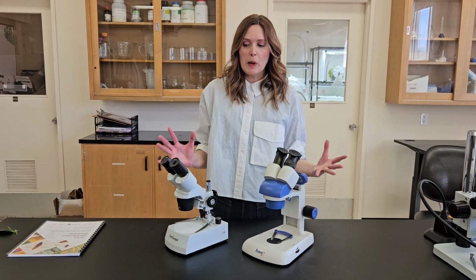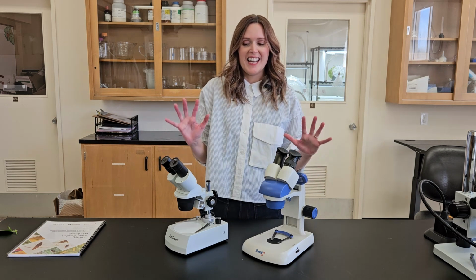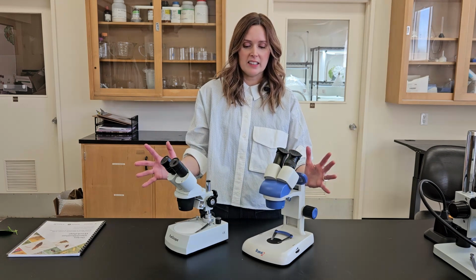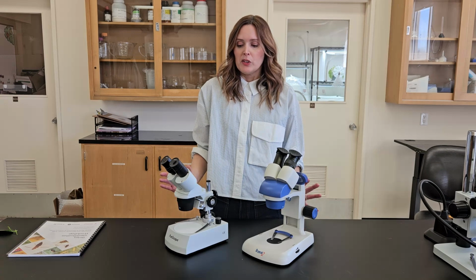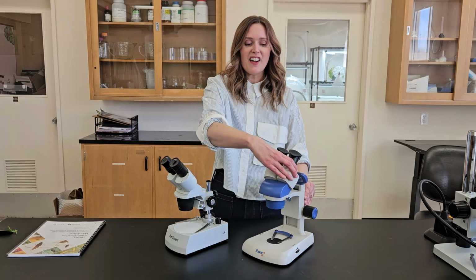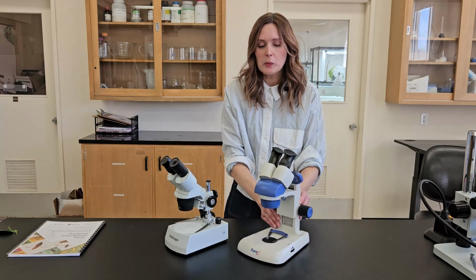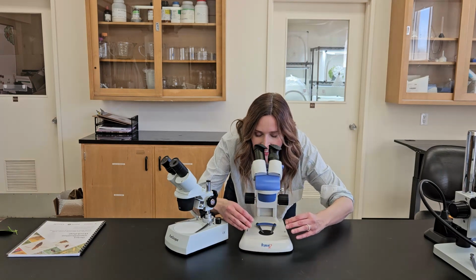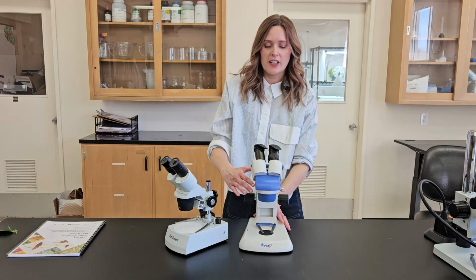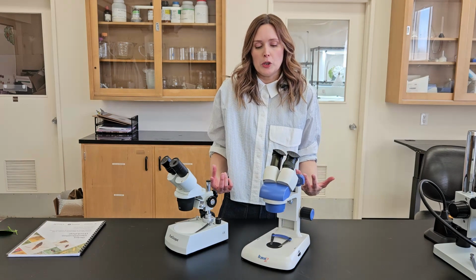So the last feature we're probably going to talk about today that can sort of make or break your microscope use is the eyepieces, or ocular lenses, of the microscopes. One of my pet peeves in the microscope world is when the eyepieces are facing away from the stage, which means when you're using it, where you're looking and where you're using your hands are sort of out of line. And I find it just very unnatural for me to use.